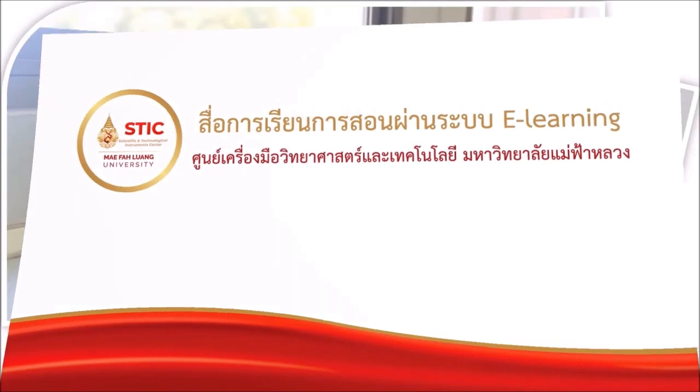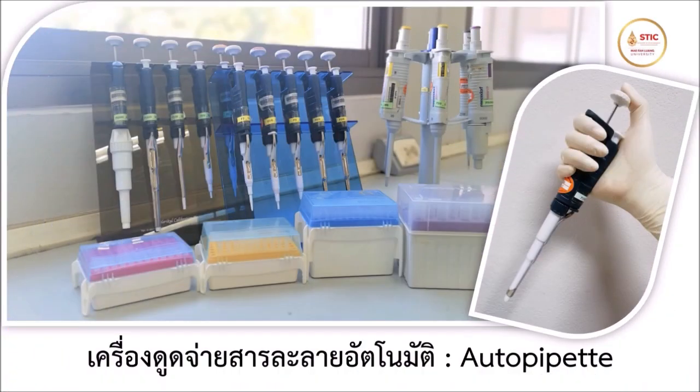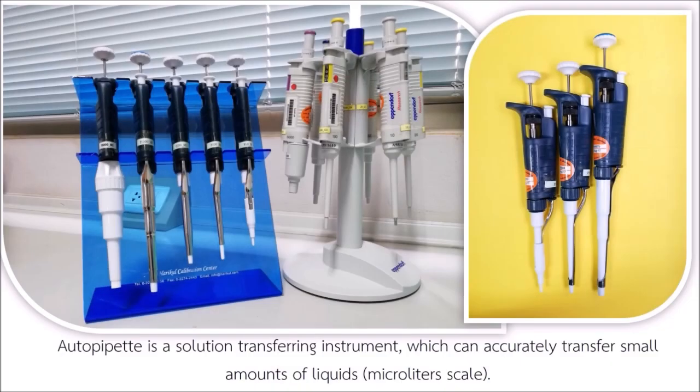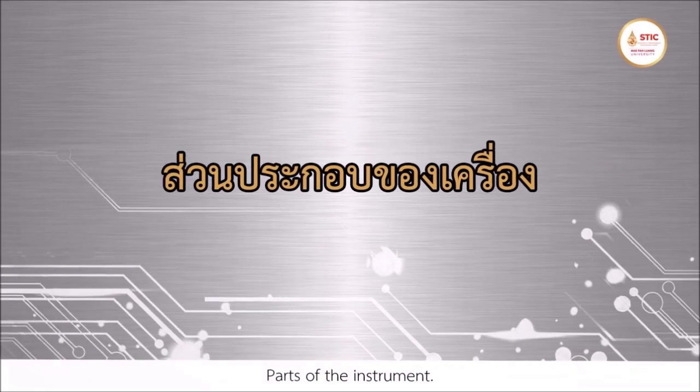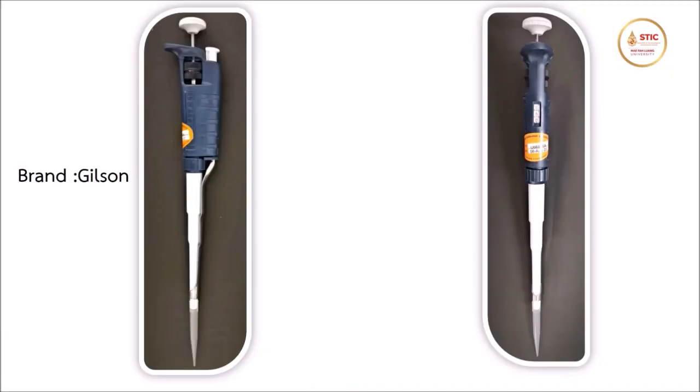Autopipette. An autopipette is a solution transferring instrument, which can accurately transfer small amounts of liquids, microliters scale. Autopipettes have many models, and are used for many applications. Parts of the instrument. Push button.